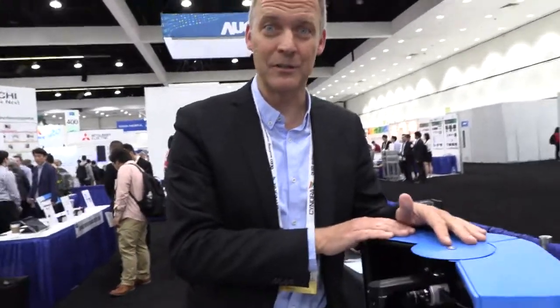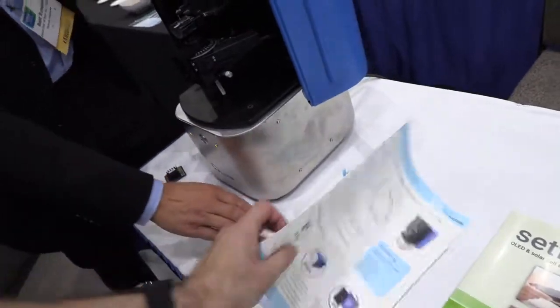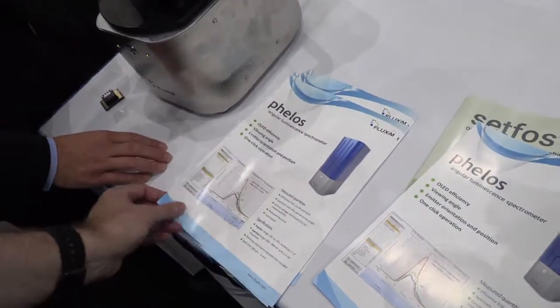They are making such research samples in order to play around with new chemicals that the suppliers of the material give them, and they need to select the right materials for the highest performance OLEDs that are stable, that are highly efficient. So we're giving enabling tools to the industry. So this is the Phelos. Phelos, yep. And this is for these kind of companies to buy? Yes. And they put in their labs? Exactly, in their research labs so they can prepare the next generation of OLED displays.